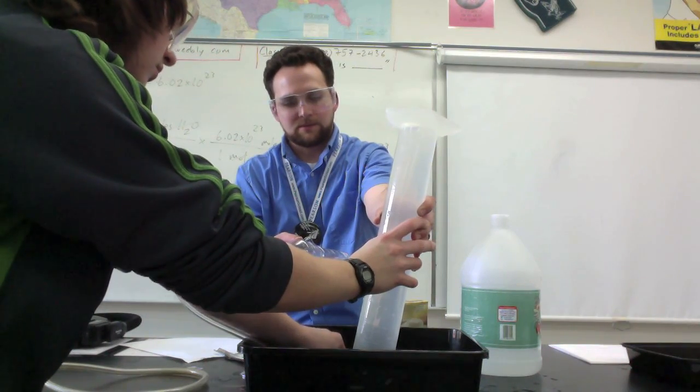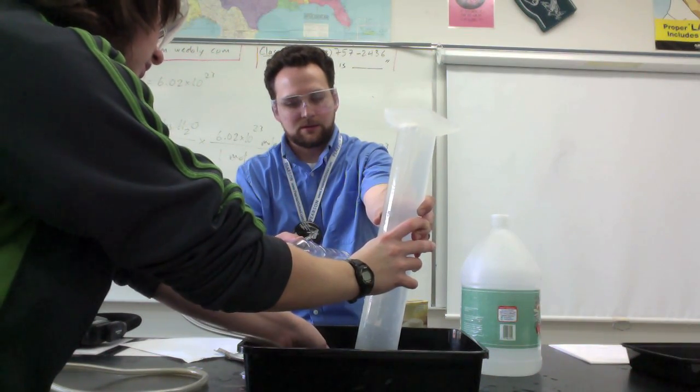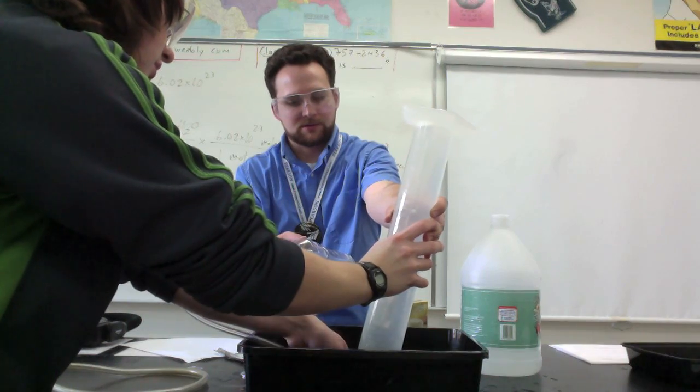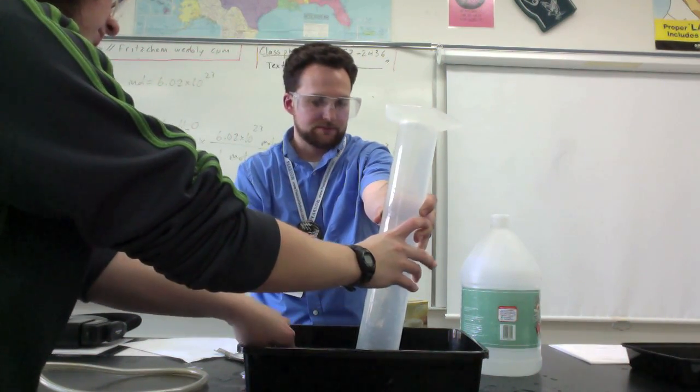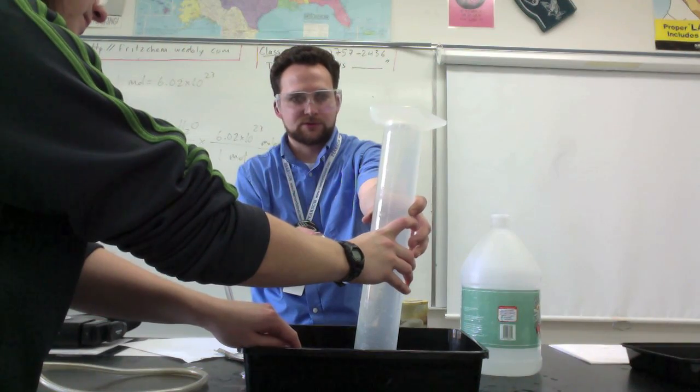So you can just try and thread it up there as much as you can. Not going up there. Here, I'll tilt it a little bit more. Got it in there, is that good? Yep. Okay, can you hold the graduated cylinder there?